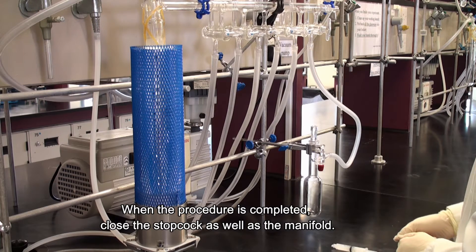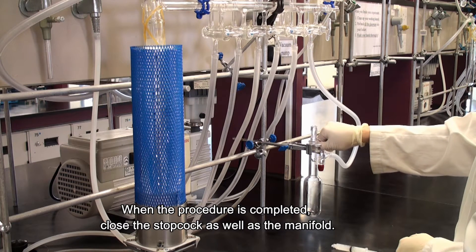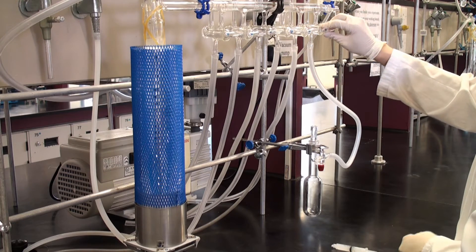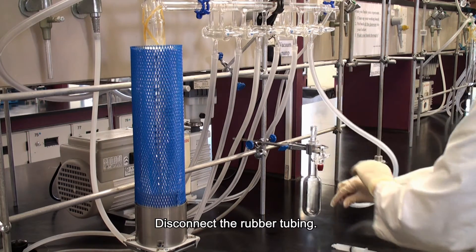After the procedure is completed, close the stopcock as well as the manifold. Disconnect the rubber tubing.